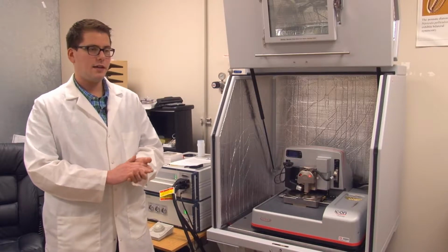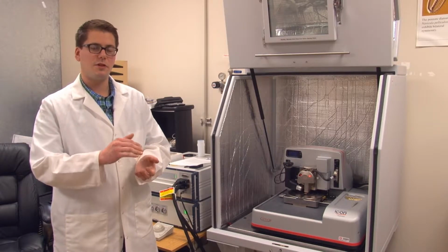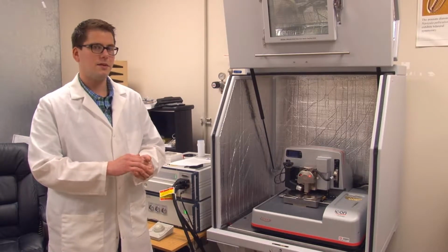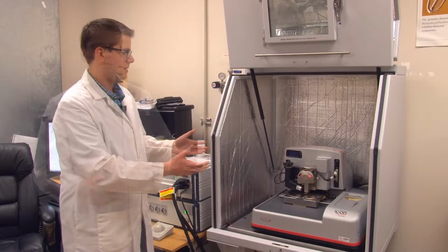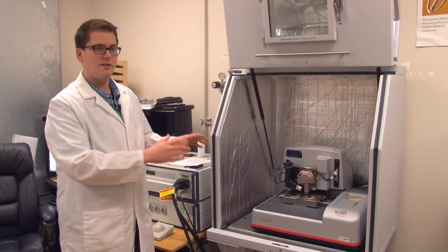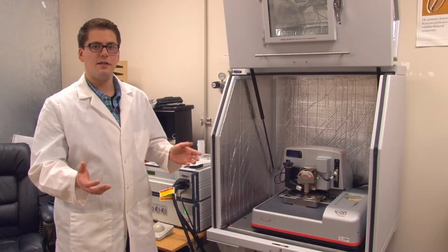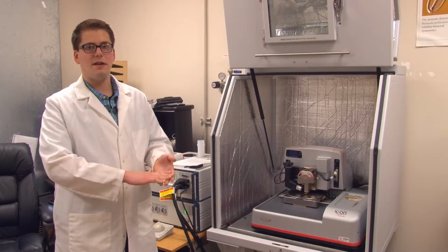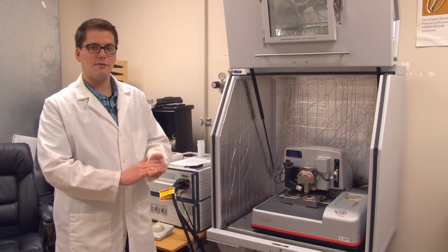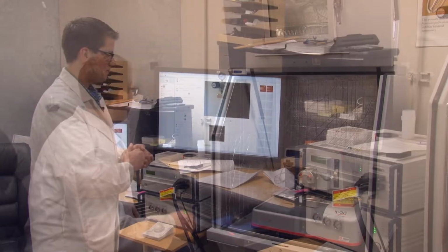In order to calculate the penetration depth of the tip into the sample surface itself, though, we need to know something about what the response of the optical feedback system is for the instrument in the condition in which it's being used. And so what I'll demonstrate now is how we calculate deflection sensitivity, which measures the bending response of the cantilever in response to pressure when it touches a surface.